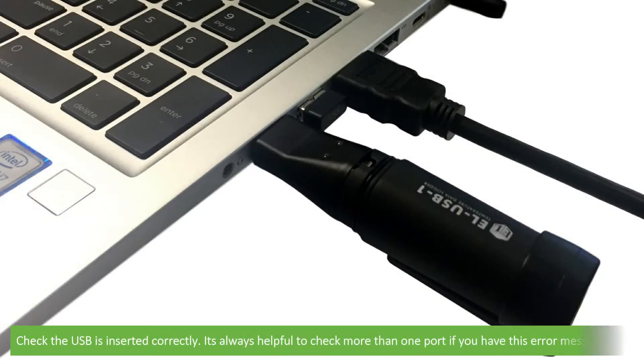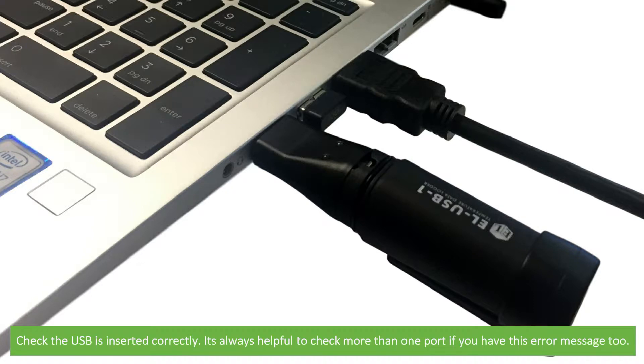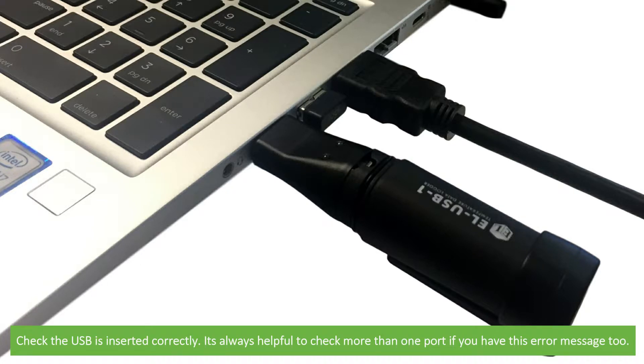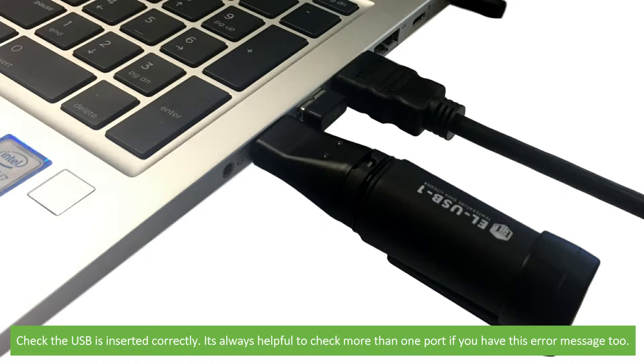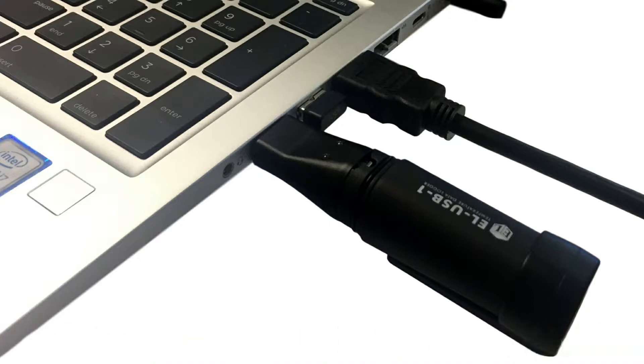While this one might seem like the most obvious, it's always important to check that the USB is inserted correctly. It's always quite helpful to check more than one port as well if you're receiving this message.